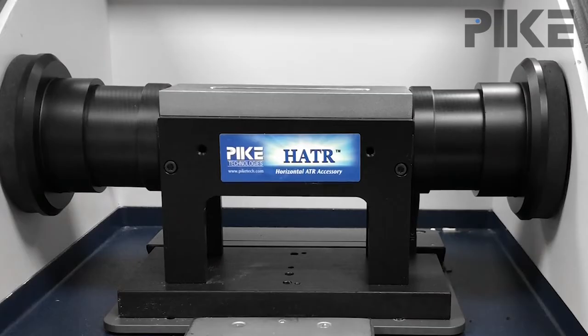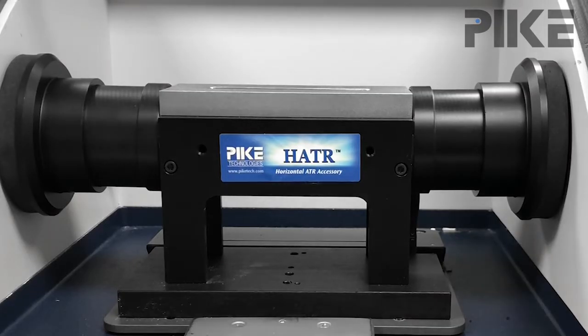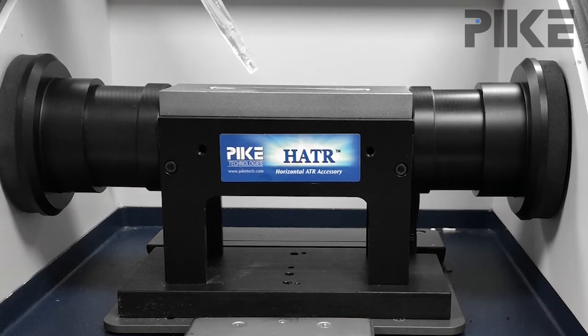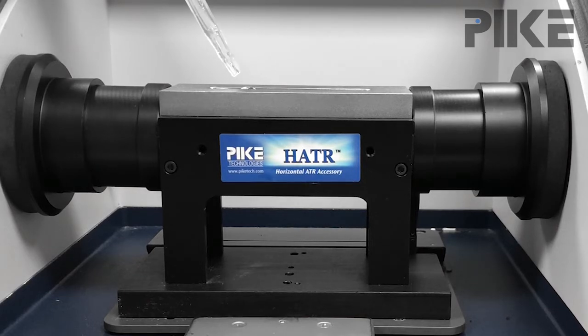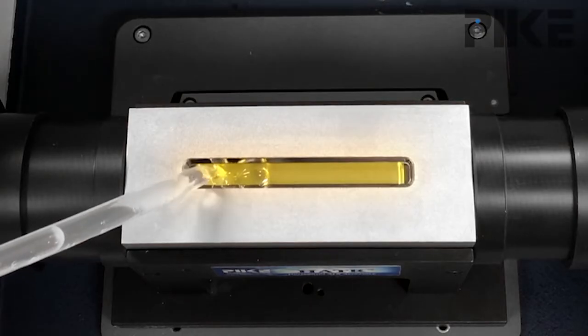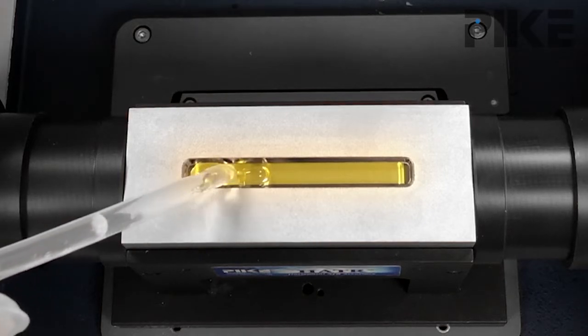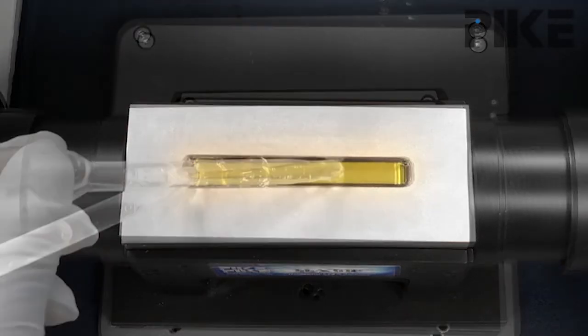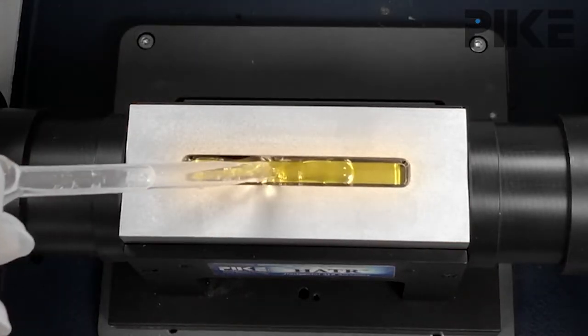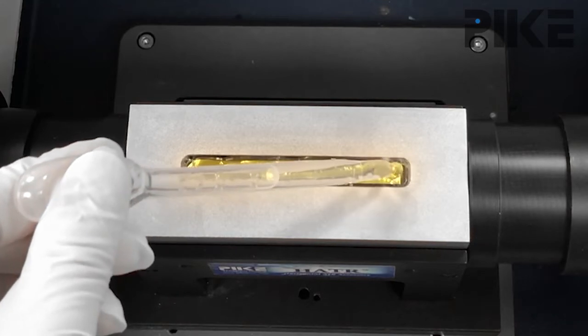Let me show you a little example of spectra I collected in the lab. I used the HATR, which is a 10-reflection ATR. I filled it up a third of the way with sample, three quarters of the way, and all the way across the surface.